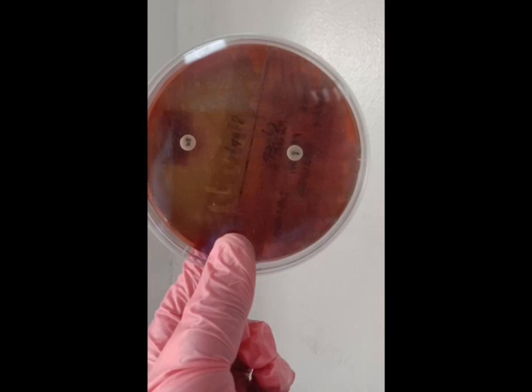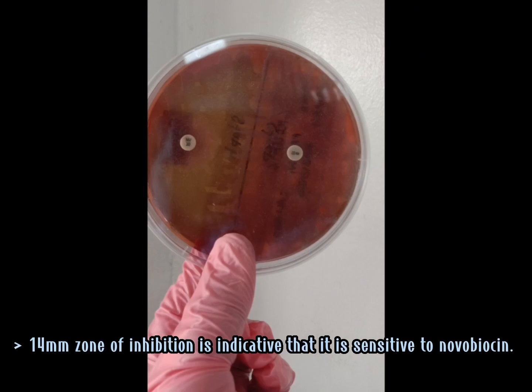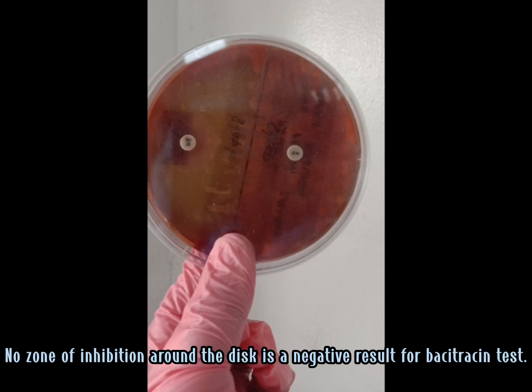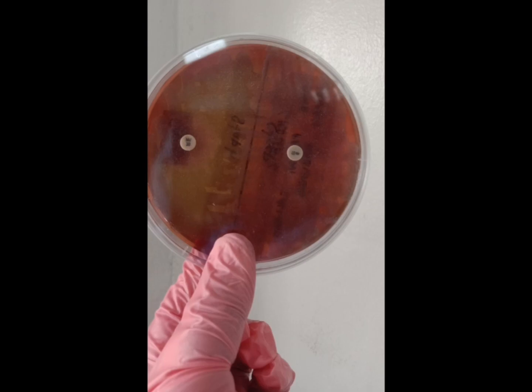After incubating it, you can see on the left side that there is a zone of inhibition in the Staphylococcus, indicating that it is sensitive to novobiocin. On the other hand, there is no zone of inhibition around the disc in the Streptococcus, therefore it is negative to the bacitracin test.